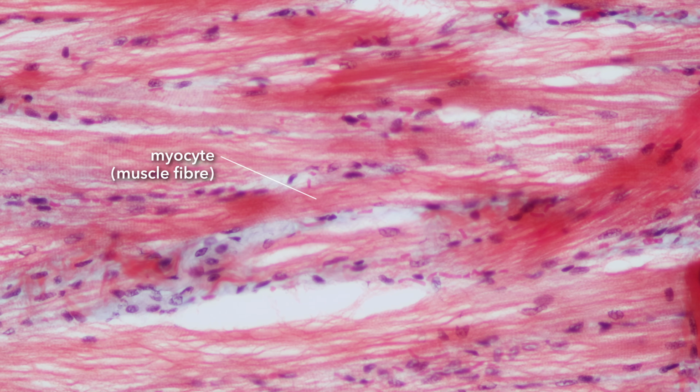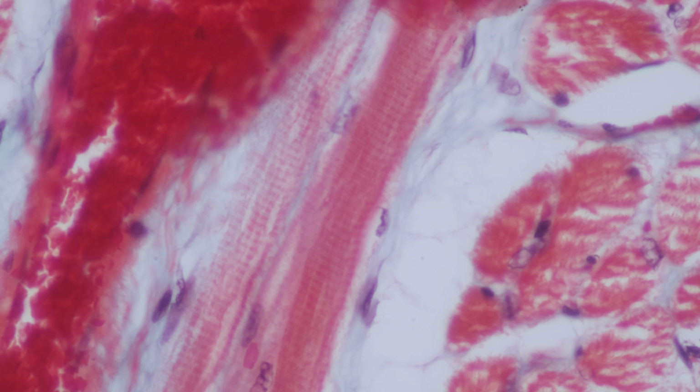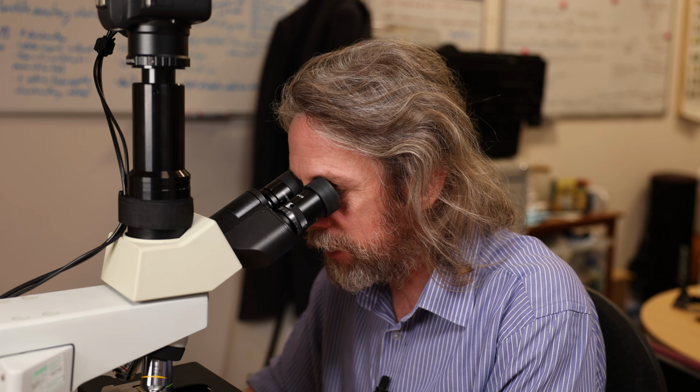So we've talked about the myocyte being formed from multiple cells. So we see lots of nuclei around the outer edge. We've talked about the sarcomeres and the actin and myosin filaments, and how we saw some Z bands, but how that forms the banding pattern of the dark bands and the light bands. And we've talked about the connective tissue and how that holds everything together.